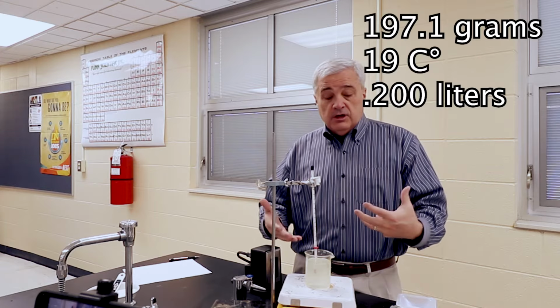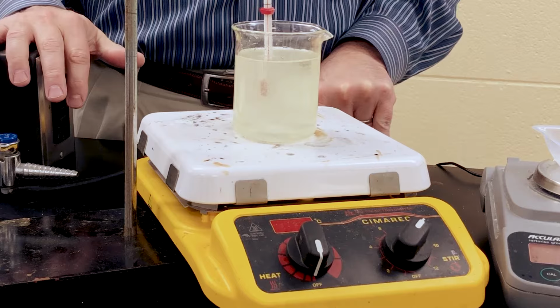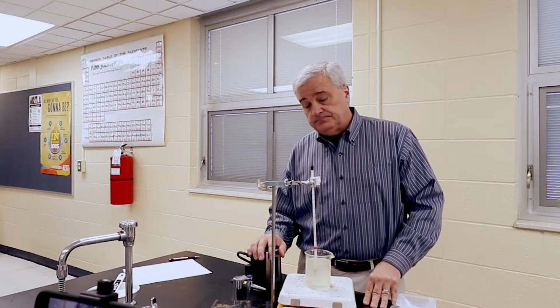Now we're going to turn on the heater and raise the temperature. We're going to go for 50 degrees. So I'm going to turn this on. I'm going to watch the thermometer for a few minutes.